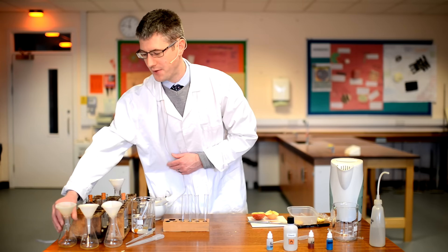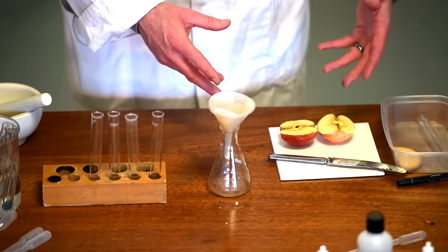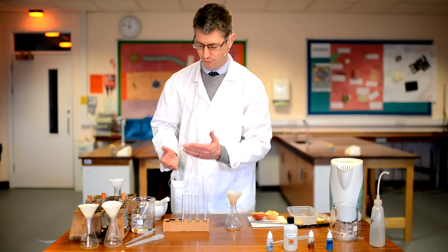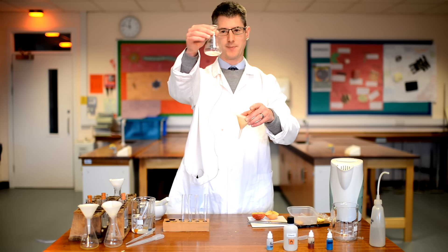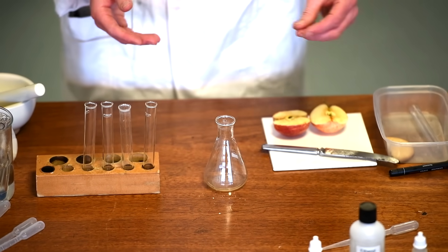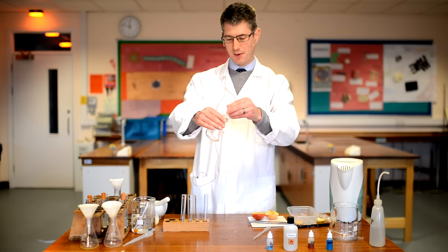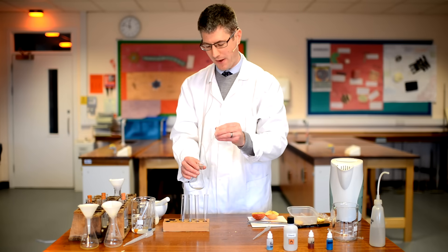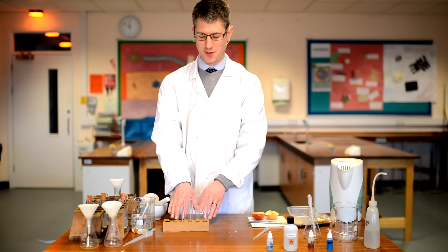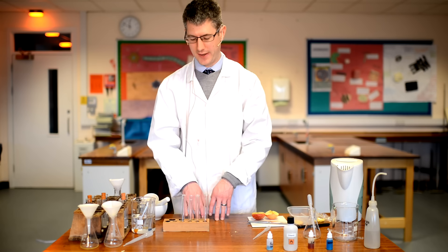I've got some filtered apple solution here — I've cut up some apple, removed the skin because the skin isn't going to be particularly useful and will just block up the filter funnel. I've ground it up in the pestle and mortar, added some distilled water, and now filtered this, giving a suspension of apple solution. We're going to do the four food tests, so we need four test tubes and I'm going to add roughly two millilitres of apple solution to each tube.